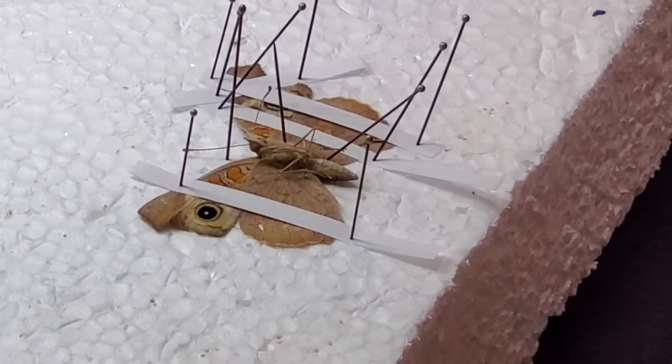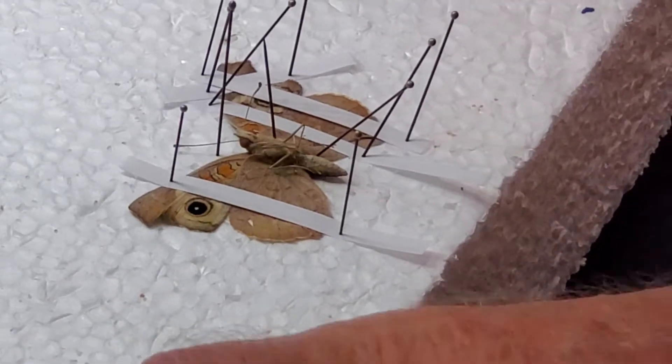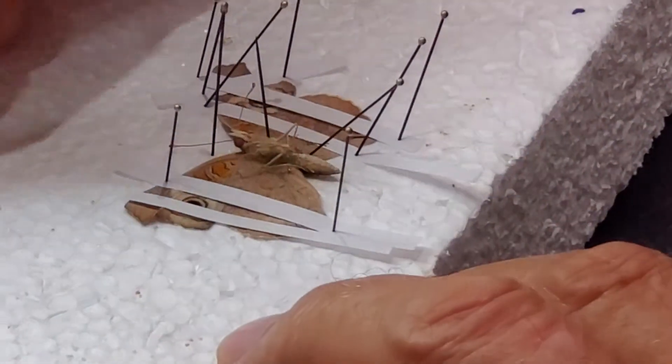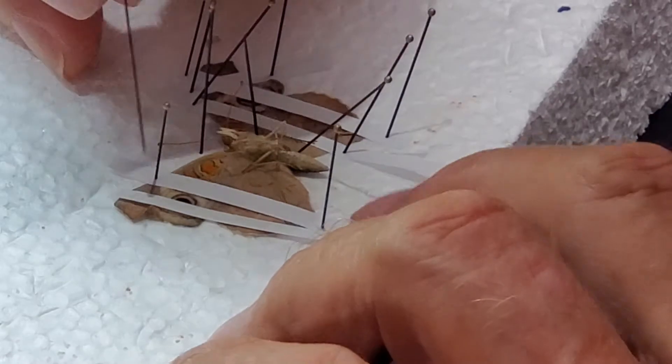One more for sure. One more piece of paper for sure. What if I tear off the paper and it's too long? Don't worry about it. If it really is too long, you can always come by with scissors and cut it off.